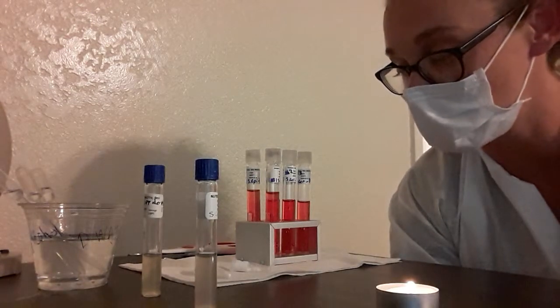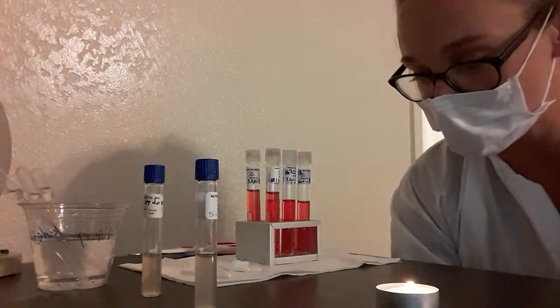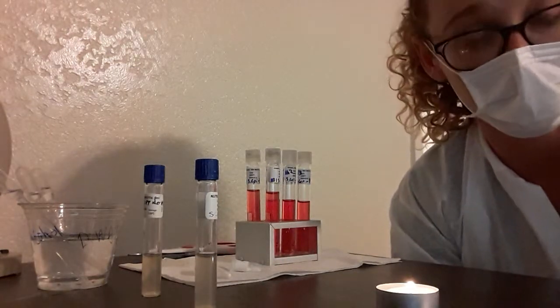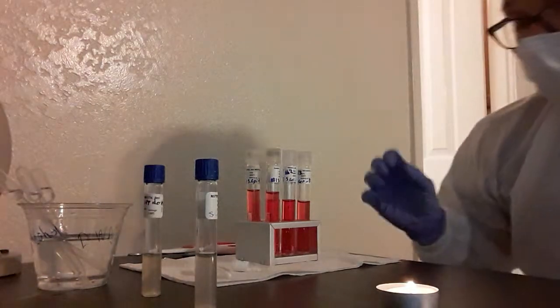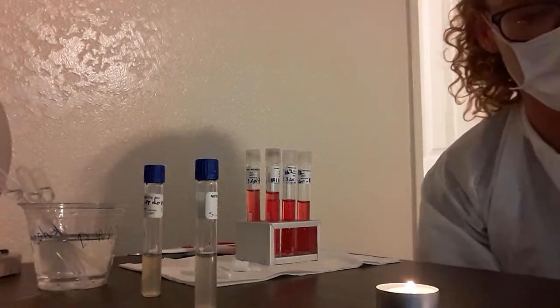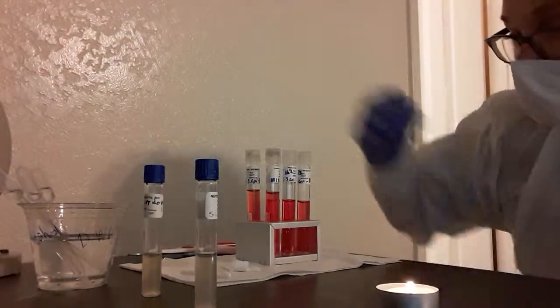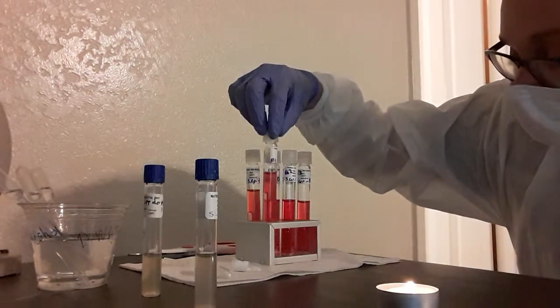This is my week 5 video, biochemical testing for microbial identifications. This is going to be done through carbohydrate fermentation testing. Carbohydrate fermentation testing is done to determine the different byproducts of fermentation. We have our phenol red broth here, and this helps with acidity.